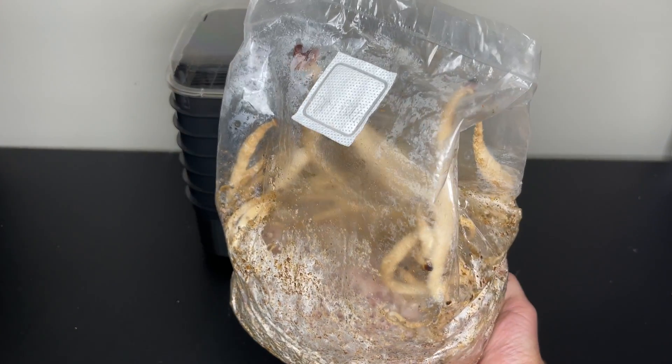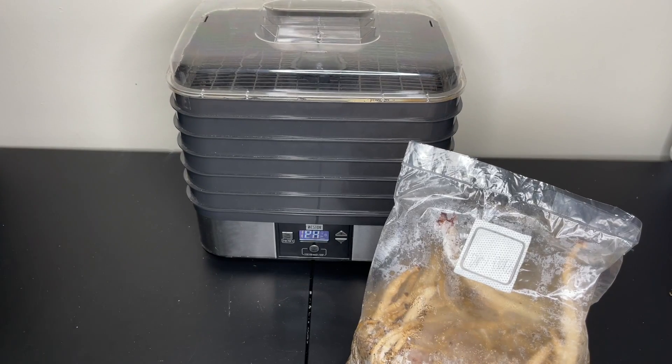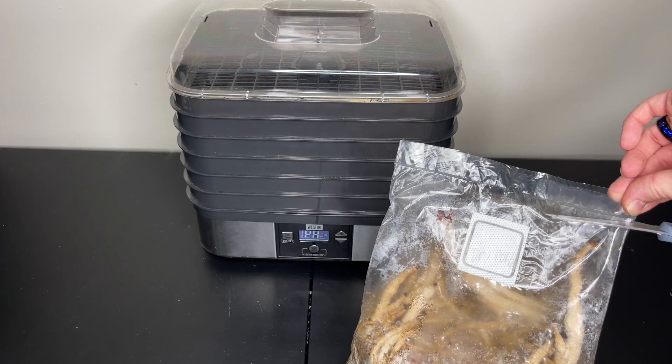For the next phase of the experiment I harvested the second flush from this bag and dehydrated it at 100 degrees Fahrenheit for eight hours.